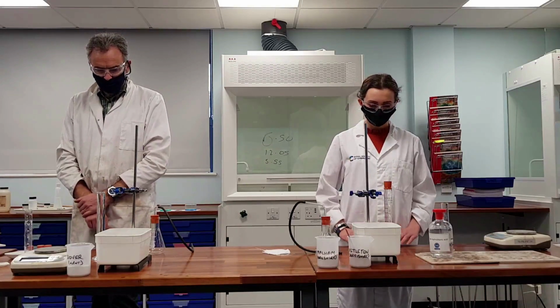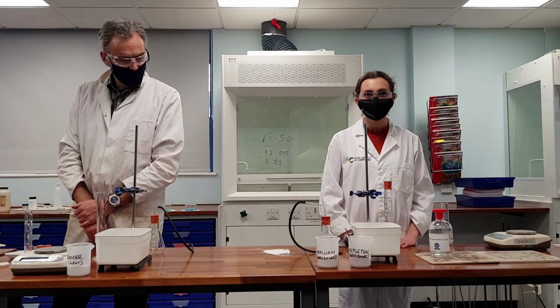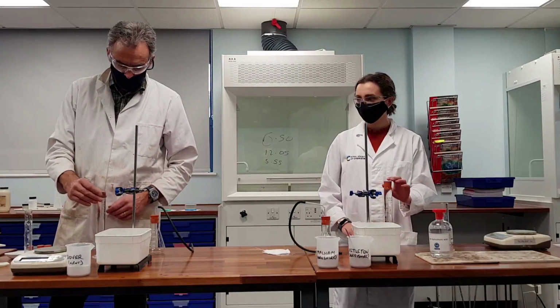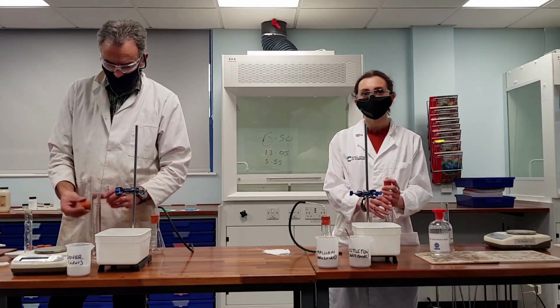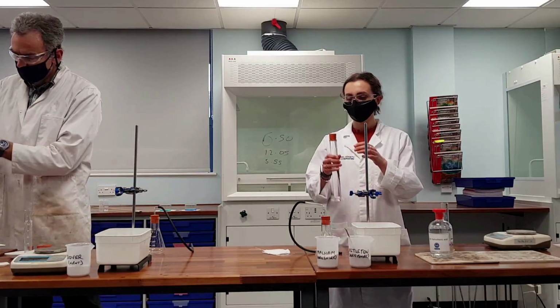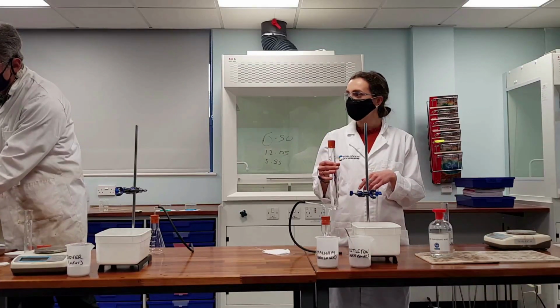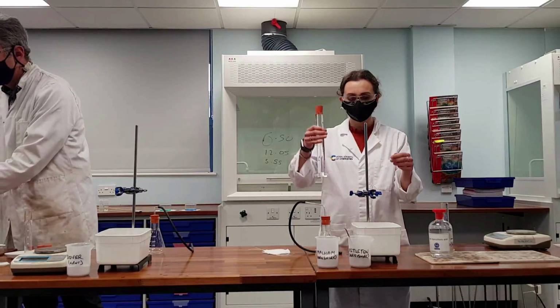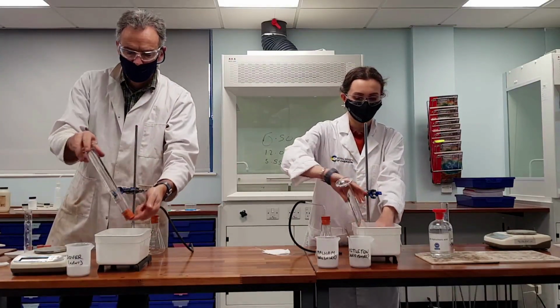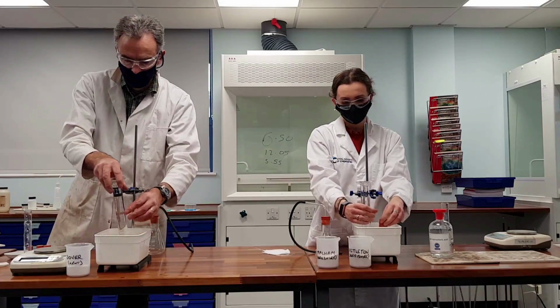So in each of the ice cream tubs, they're just full of water, and we are going to first of all invert a measuring cylinder which we're going to use to collect the gas. We're going to fill that measuring cylinder absolutely full of water, and then we are going to carefully but quickly turn it upside down into the trough of water so that it remains full of water. And look at how both Mr. Reeves and Miss Richardson did that.